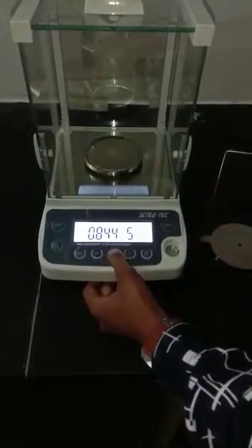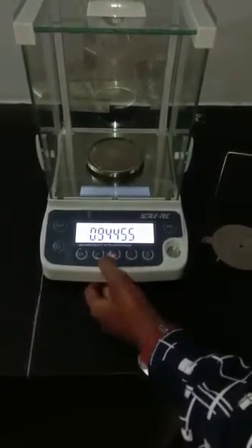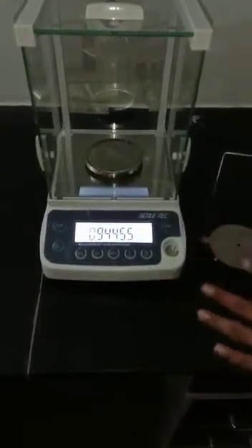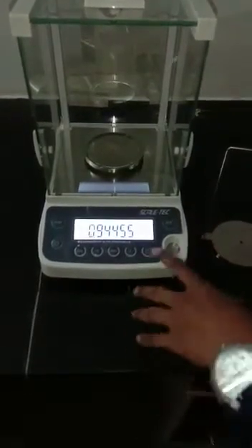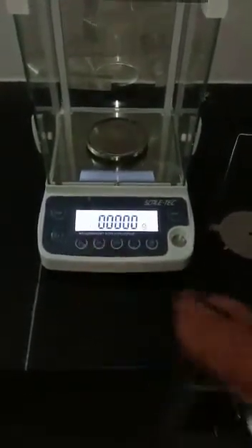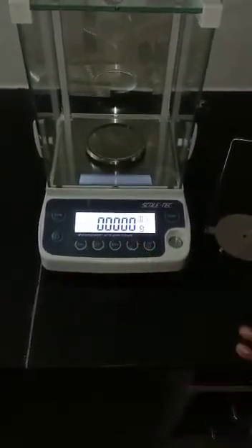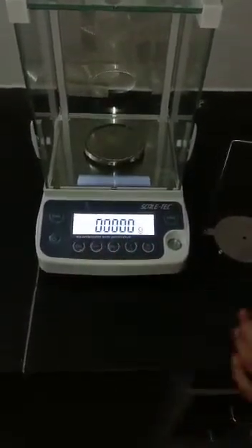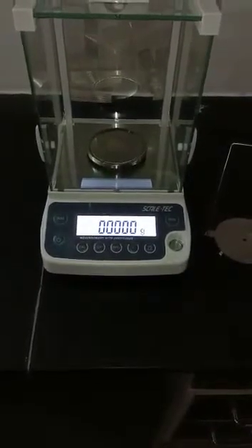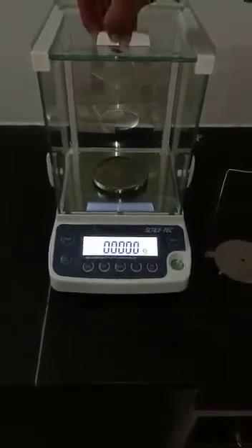For example, I have entered 0.94455 as a particular density value. Now press CF, then press F once again — CF. Now let's go through how to set up this weighing assembly into the balance.